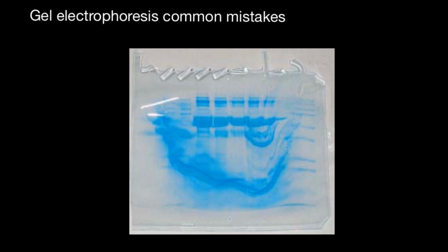Probably this is going to be my shortest video ever made. And if you take a look at this gel, the first thing that you probably think would be that electric current was set too high and for too long, which caused gel melting. But this is not the case.